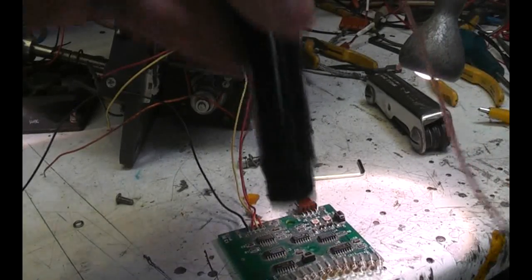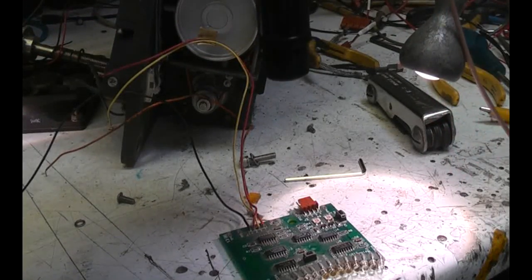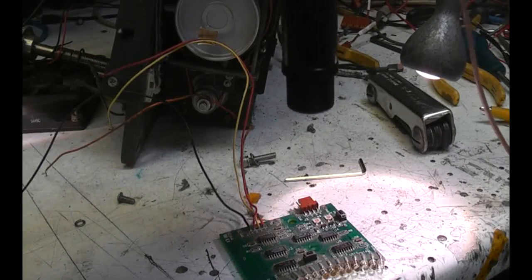Let's look at the output from this camera. I just powered it up and as expected it's looking at a fairly small scale - that's a 0.4 mm grid, so it's got about a 10 mm or so field of view. This is quite a nice little lens on the camera. Going through the mirror arrangement, it's got quite a decent working distance - when it's in focus it's got about 60 to 70 mm working distance. It's potentially quite a useful little microscope camera.